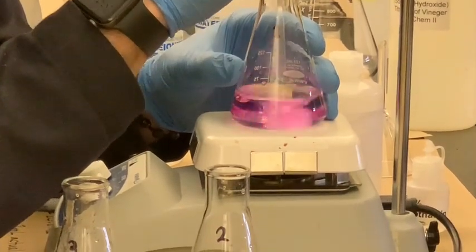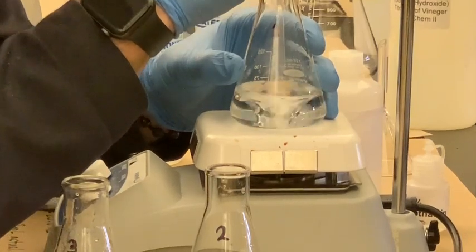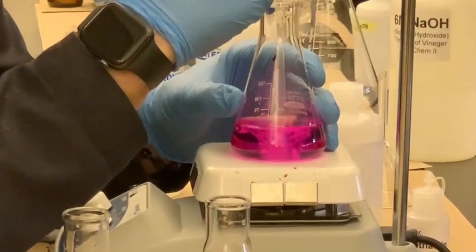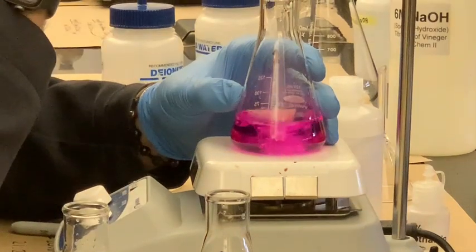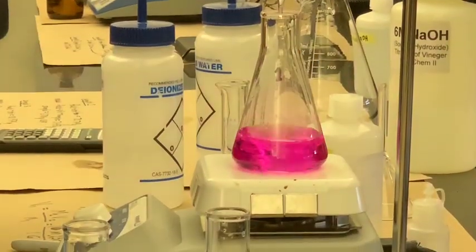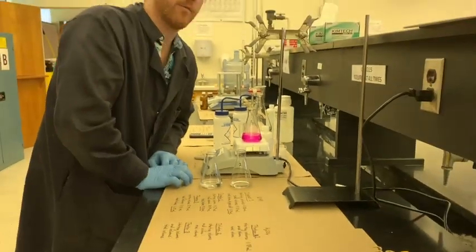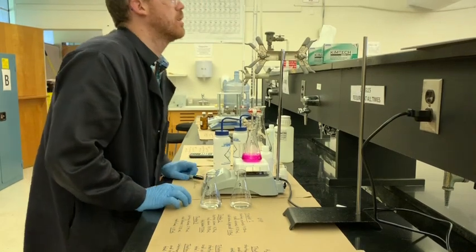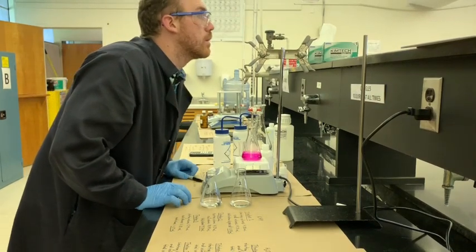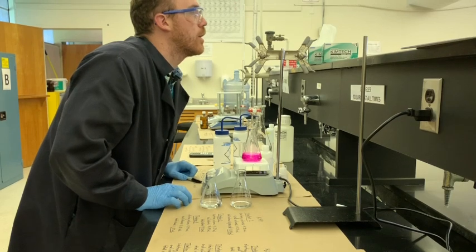One more drop. Oh, that was dangerous. See, you got to be very careful with your hand there. And oh, that's how quickly it can change. Just 2 drops. Wow, I really did it there. So at least this was the first one. It was rough, like I mentioned before. Let's take the final volume here. Doing this on camera is a little harder than doing it normally, that's for sure.